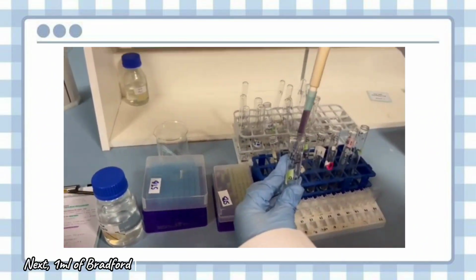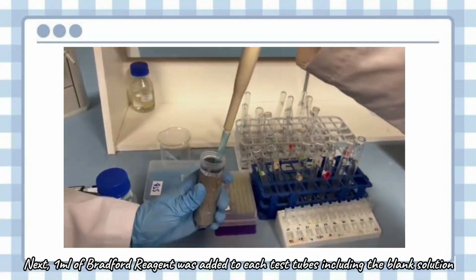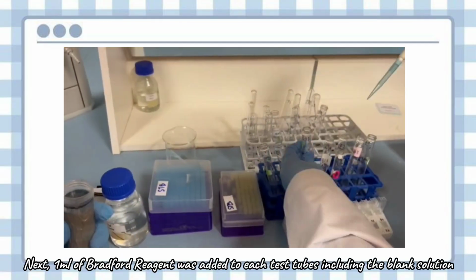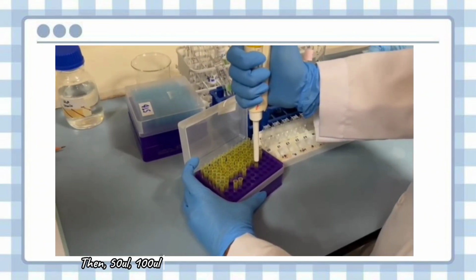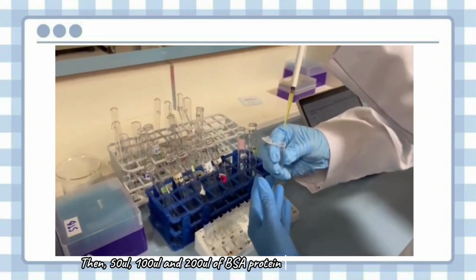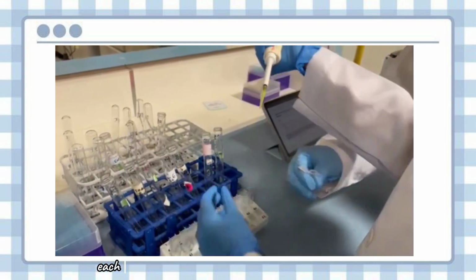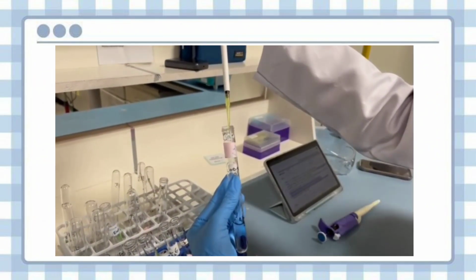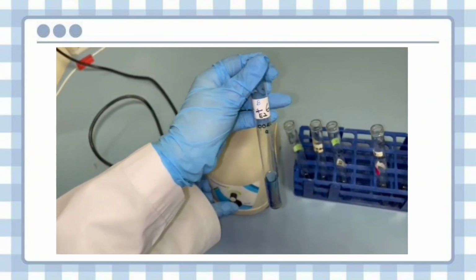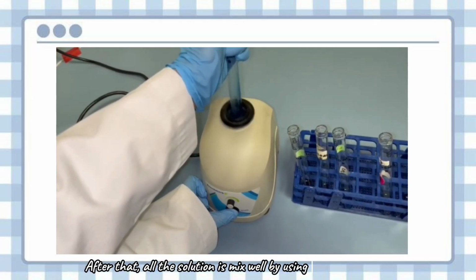Next, 1 ml of Bradford reagent was added to each test tube, including the blank solution. Then 50 microliter, 100 microliter, and 200 microliter of BSA protein standard were added to each test tube in duplicate, except for the blank solution. After that, all the solutions are mixed well by using a bench mixer.